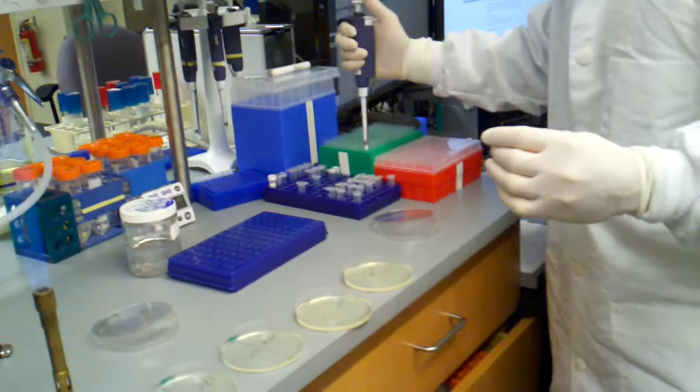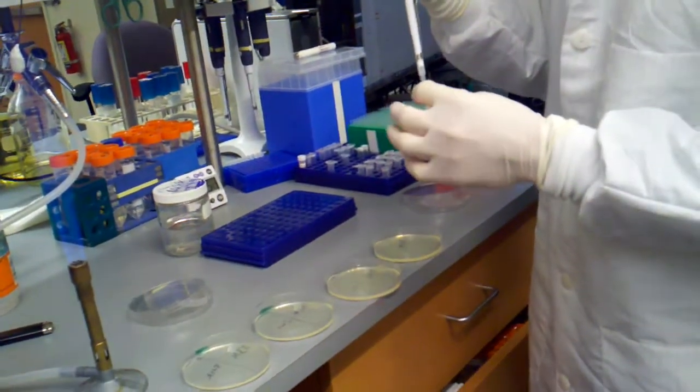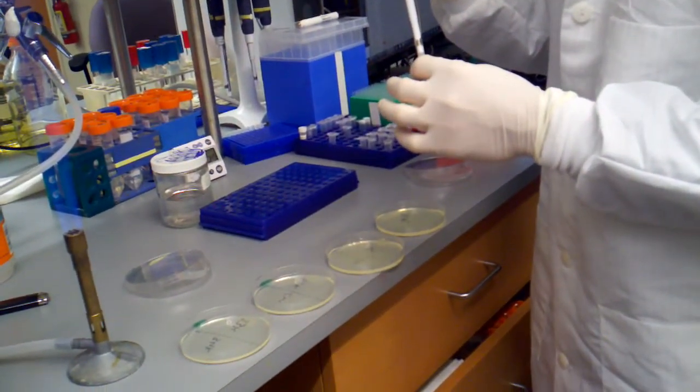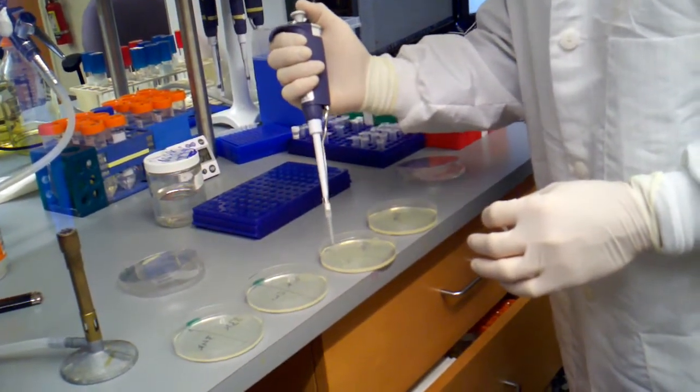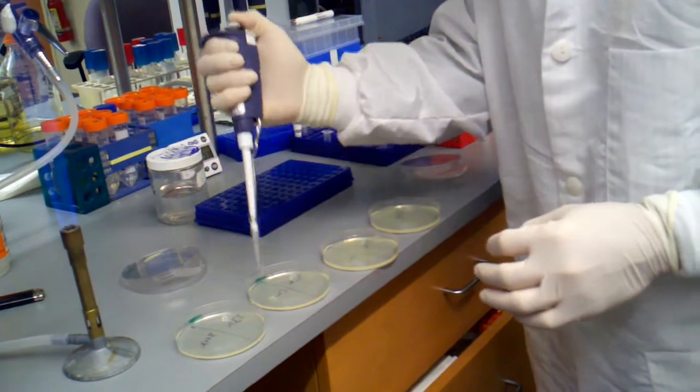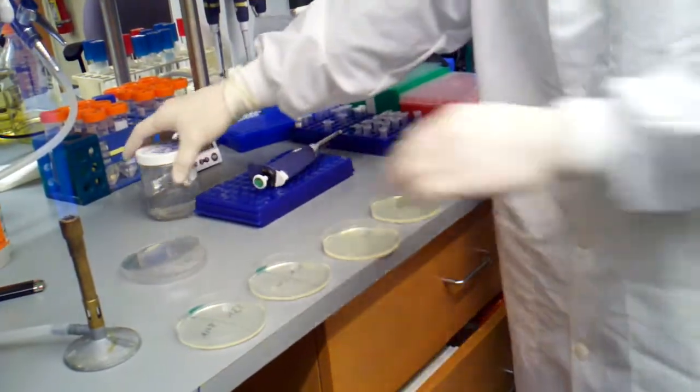And finally I have my control, so I'm just going to pipette a little bit onto each plate. This is a lot less than 75, so I'm just going to do a tiny spot, a spot there, and a spot there. So now all of our cells are on the plate, and we just gotta spread them.